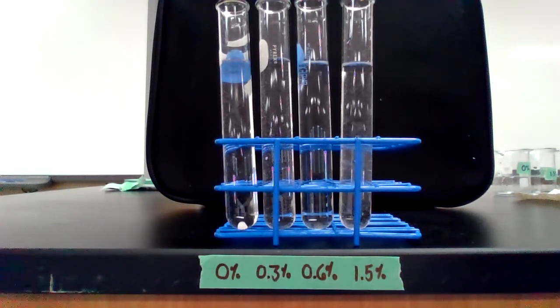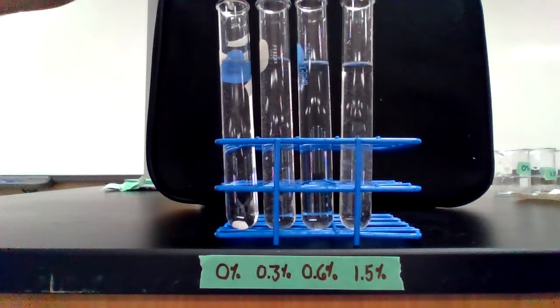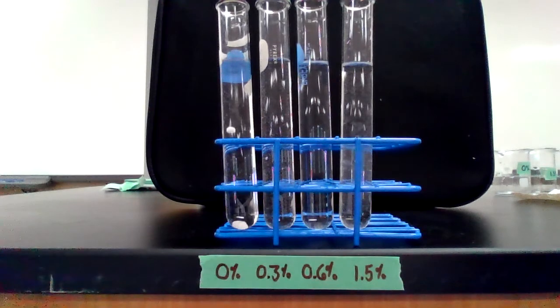I'm only going to run 3 control trials just to make sure nothing weird happens. And we'll just let those sit there as we continue to run the remainder of the trials to make sure. So here comes the second control trial. Ready, set, go. And here's the third control trial. Ready, set, go. So we'll leave those sitting there as we run the next few trials and just make sure that they don't float to the top.